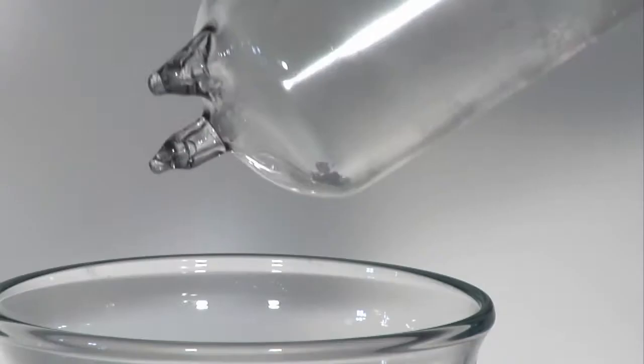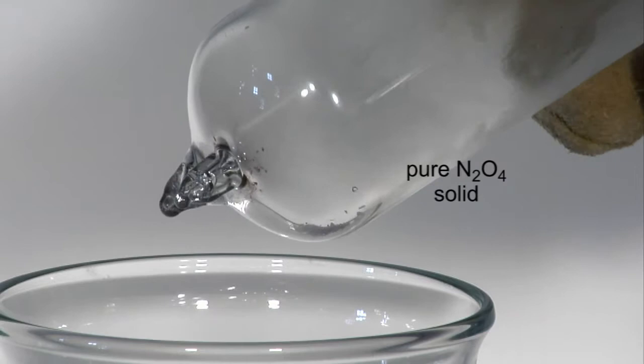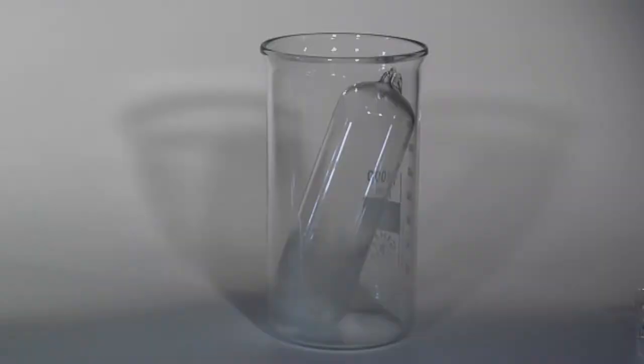At this temperature, the equilibrium is shifted completely in favor of only dinitrogen tetroxide, which is present as colorless solid crystals.